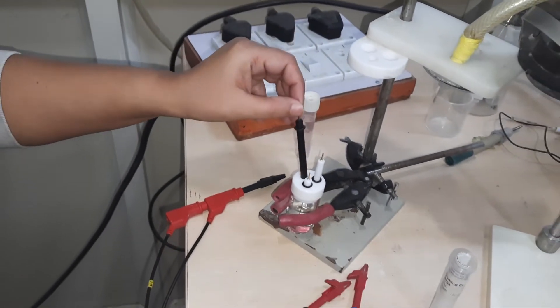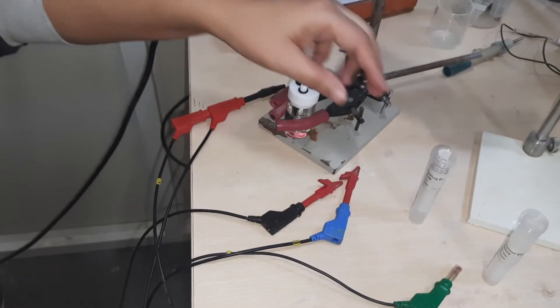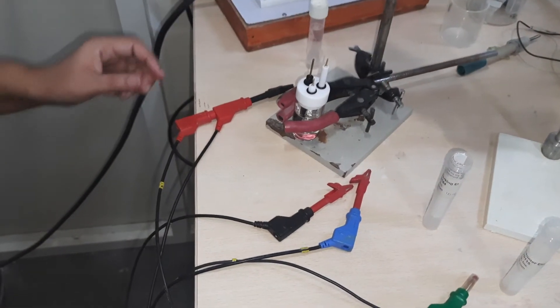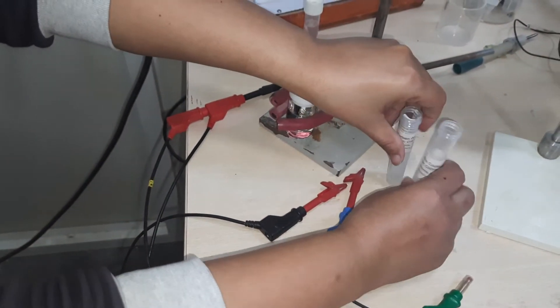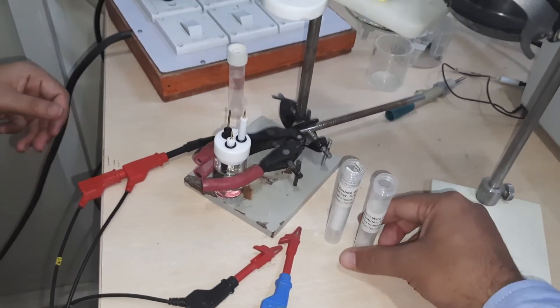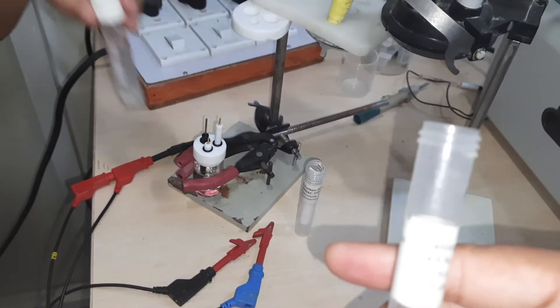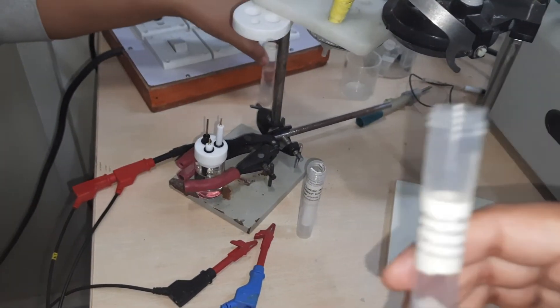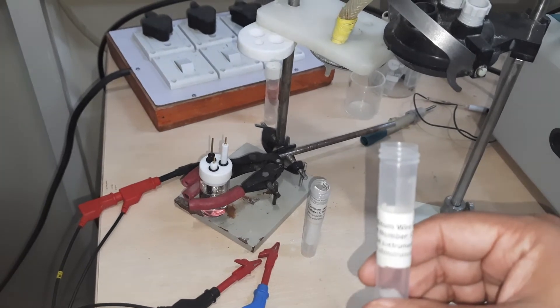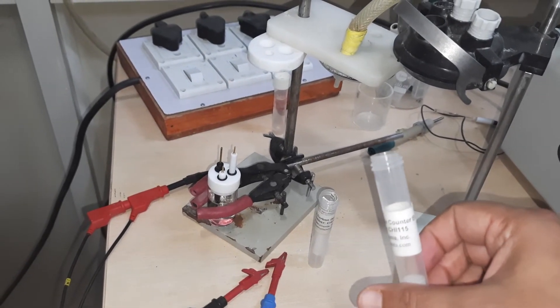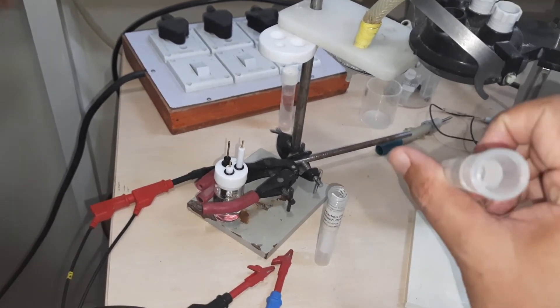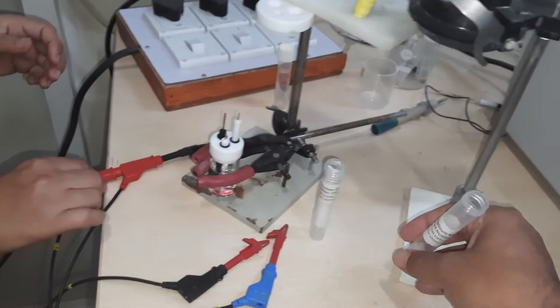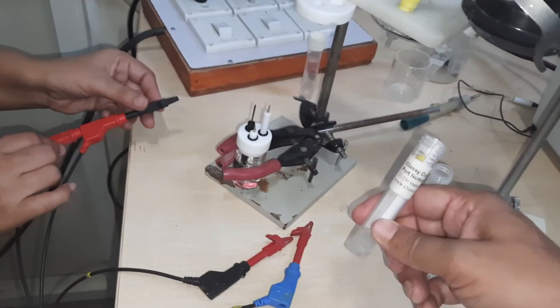Now let us see the crocodile clips that are being used. Let's see this electrode - this is the counter electrode. We store the counter electrode over here, and this is the glassy carbon working electrode container.